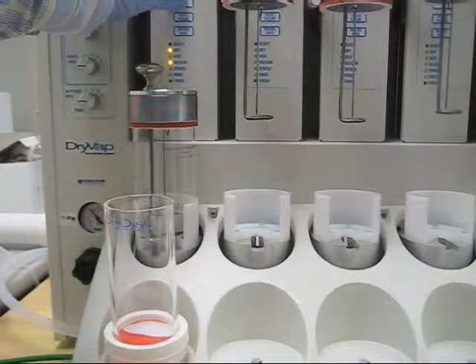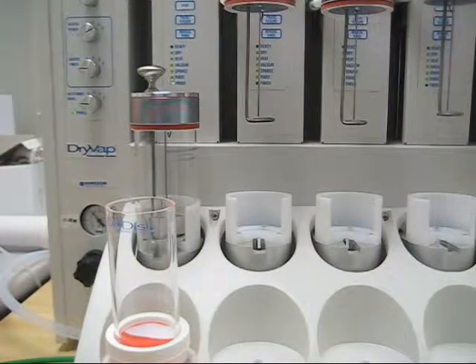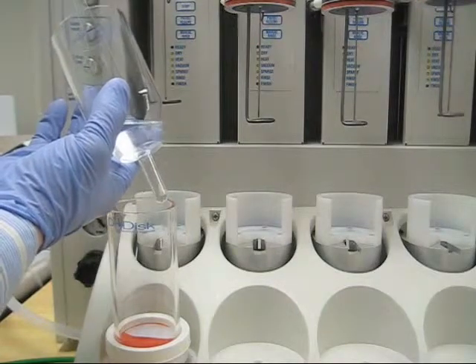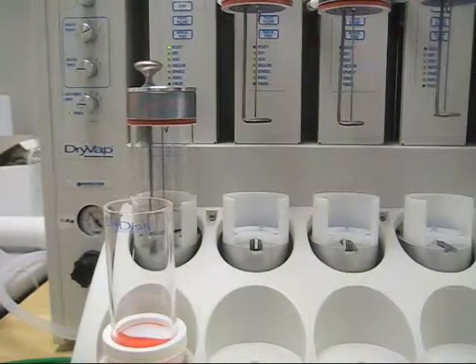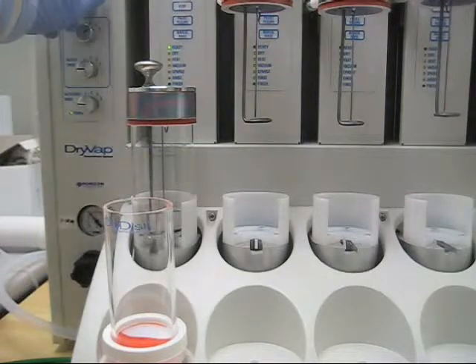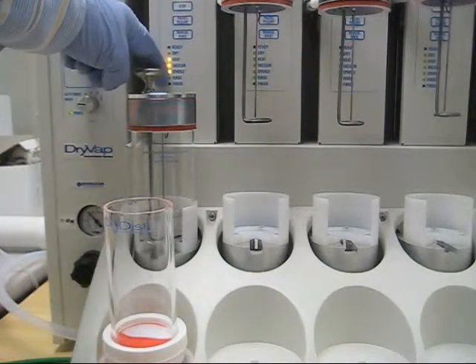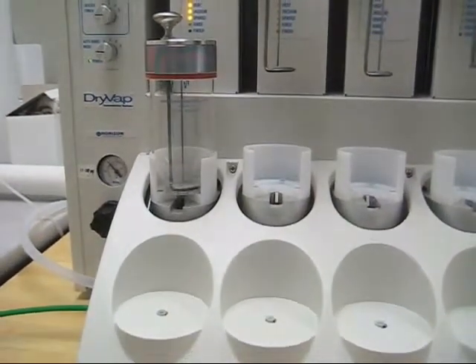At this point, I'm going to stop the drying process. Because methylene chloride is very dense, I'll take a pipette and manually mix the hexane and the methylene chloride — coming over here with the pipette, sucking up that bottom fraction and dispersing it across the top about three times, to ensure a good mix of your hexane and methylene chloride. After mixing with the pipette, you want to leave your heater power on five, but turn the dry volume off, hit start, and skip the drying process going straight into heat, vacuum, and sparge.